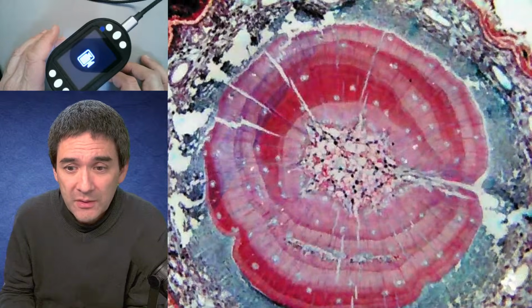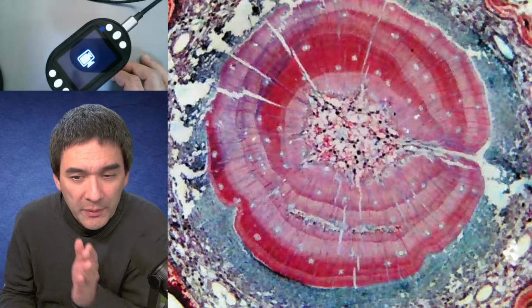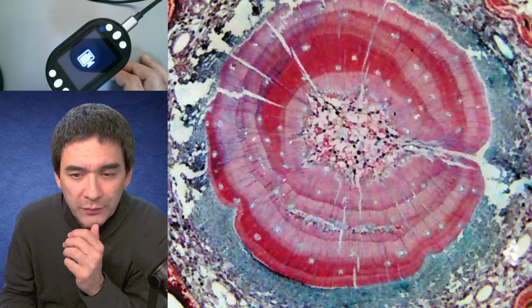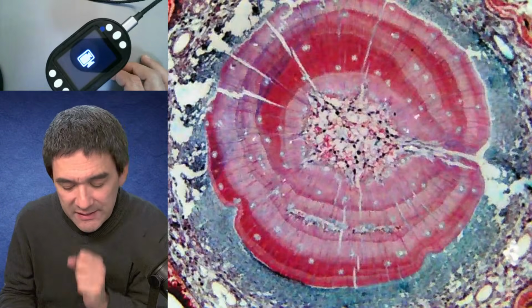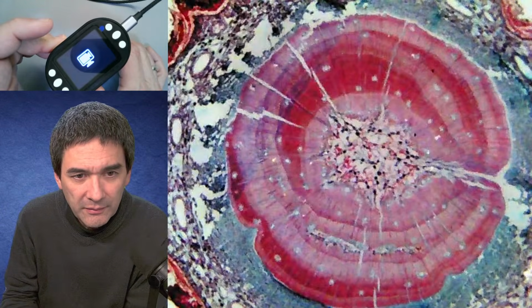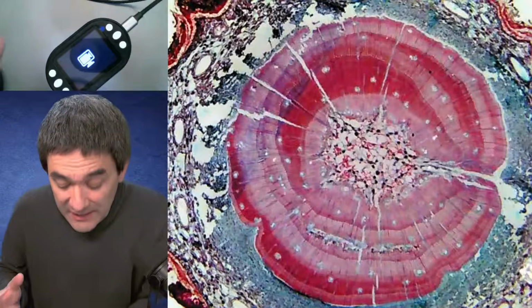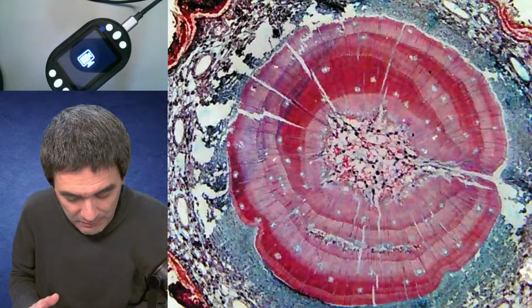So that is the thing. I'm reading a comment: Don't buy anything that will frustrate the child. That's the question. To what extent will these devices actually give access to science and to nature exploring, or to what extent is it frustration?